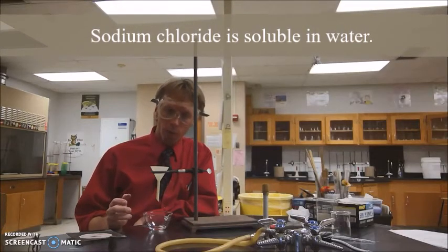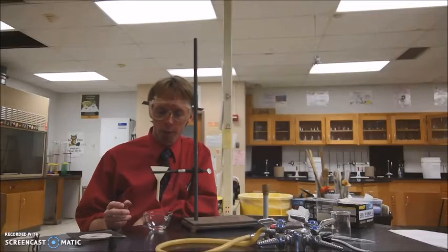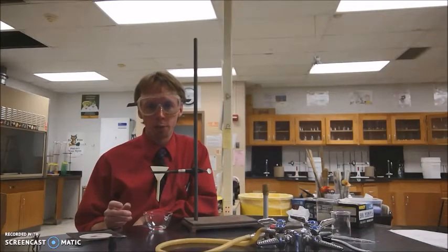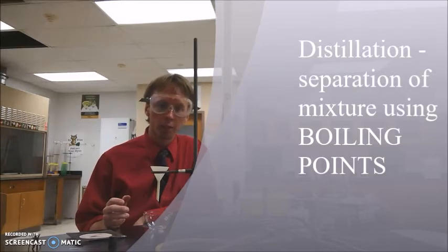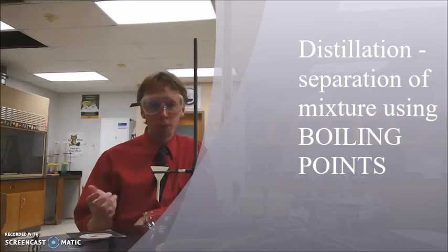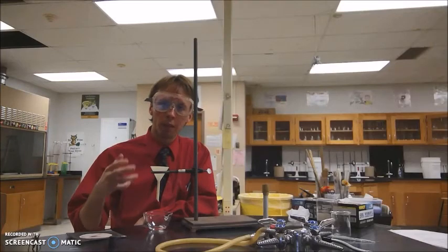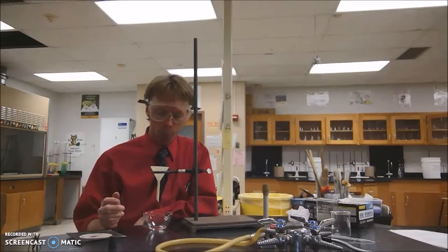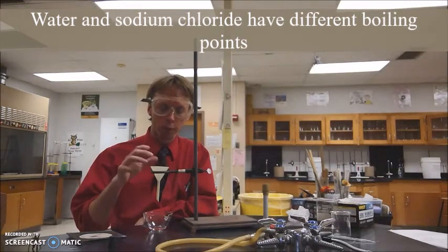And so in order to recover the sodium chloride that we created from our chemical change, we're going to need to do another separation process called a distillation. While a filtration takes advantage of particle size to separate a mixture, distillation takes advantage of the difference in boiling points between two substances. Normally for a distillation apparatus, you'll collect the liquid that you're boiling off, but in this case, we don't need to do that. We're going to take advantage of the differences in boiling points between the water and the sodium chloride.